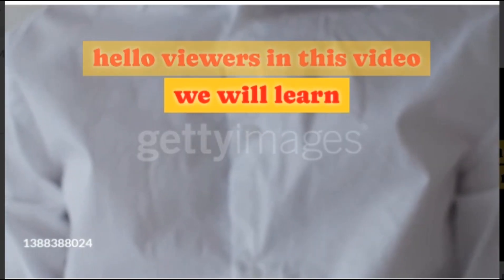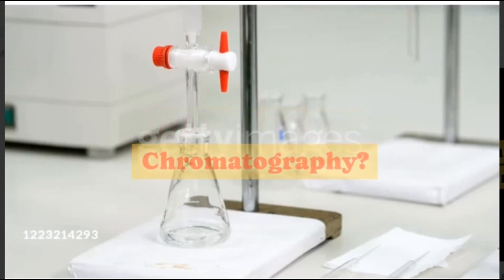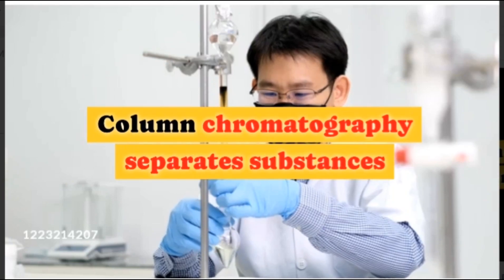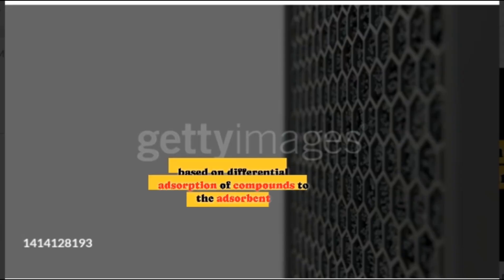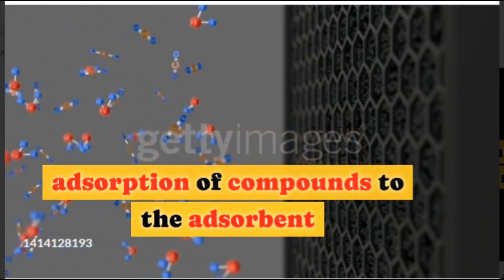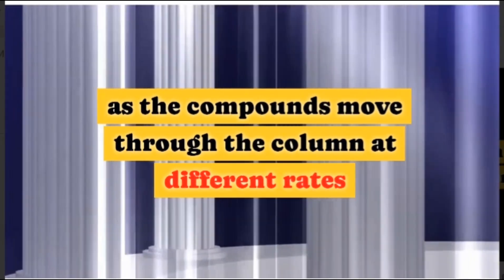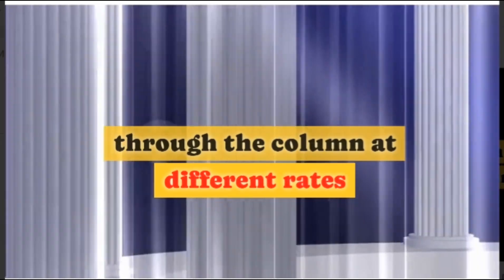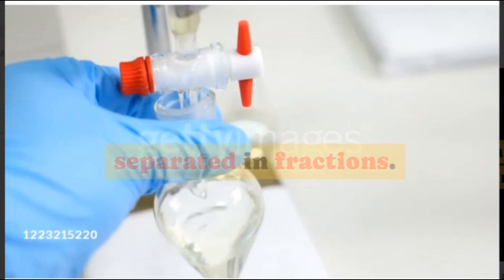In this video we will learn what is column chromatography. Column chromatography separates substances based on differential adsorption of compounds to the adsorbent as the compounds move through the column at different rates, which allows them to get separated in fractions.